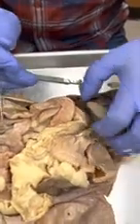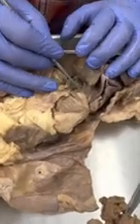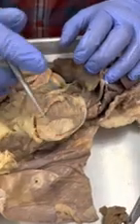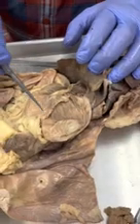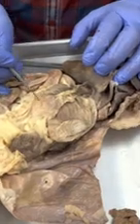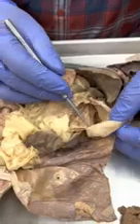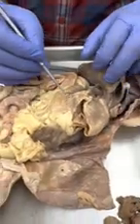Okay. So this is the stomach here. Looking at the regions of the stomach, we come into the stomach, which is right here, and that's the cardiac region. And then when the stomach bends up, that's the fundic region. Here is the body of the stomach. After it makes that turn, this is the pyloric region of the stomach. We go inside, and we're seeing these little grooves in here. Those are called rugae. Okay.